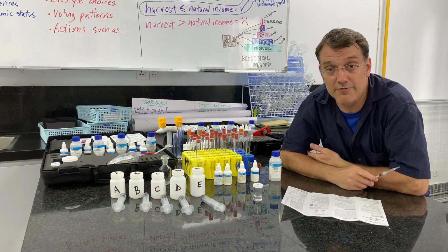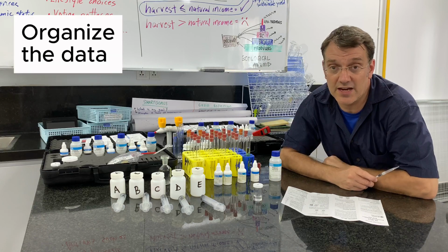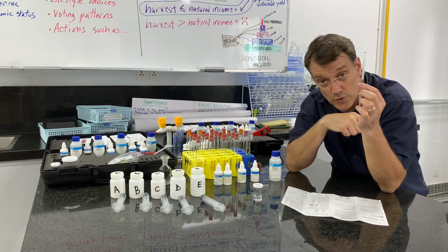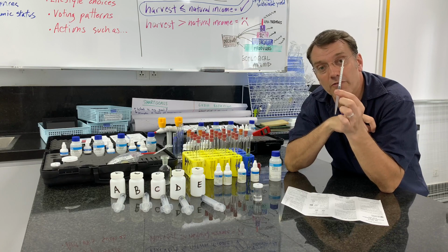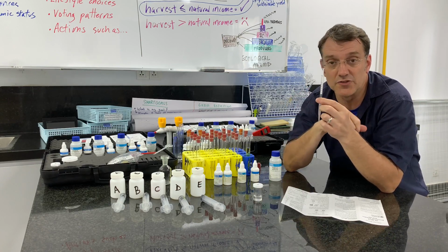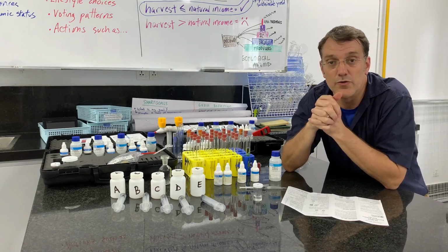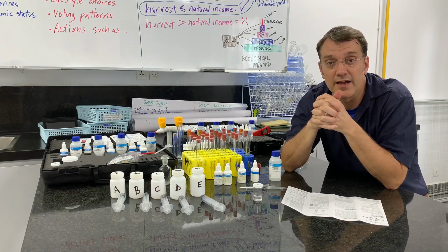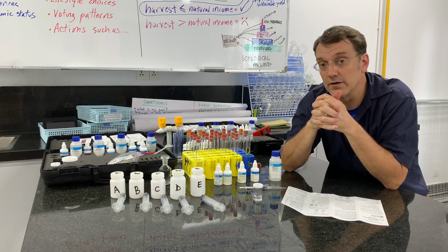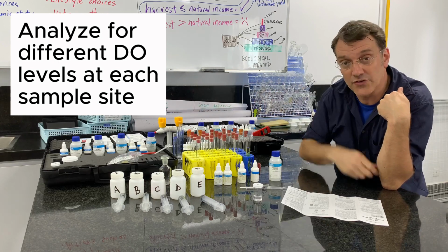I'm going to do that for every single sample at all of the sites, and I'll organize it into a data table, probably with a column where I simply record the measurement off this syringe, and then the next column over, I just multiply each of those cells by 10 to give me a parts per million indicator. From that point, you can begin to process your data and determine whether there are differences in dissolved oxygen between the different locations that you've tested.